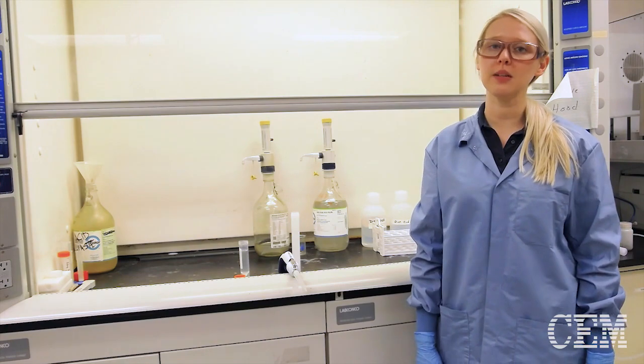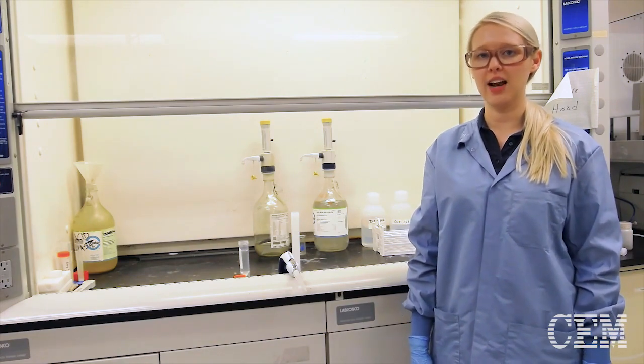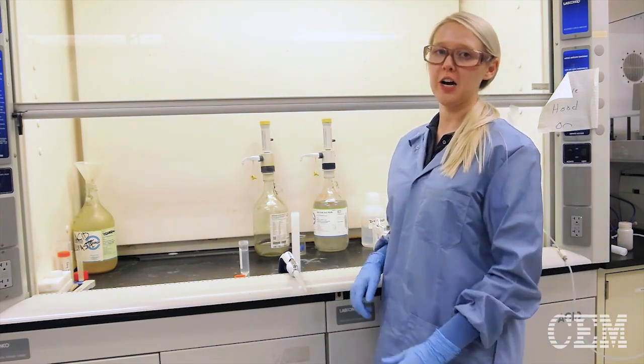The best way to do this is to rinse down your sidewalls with acid as you're adding it. So let me show you how to do this.